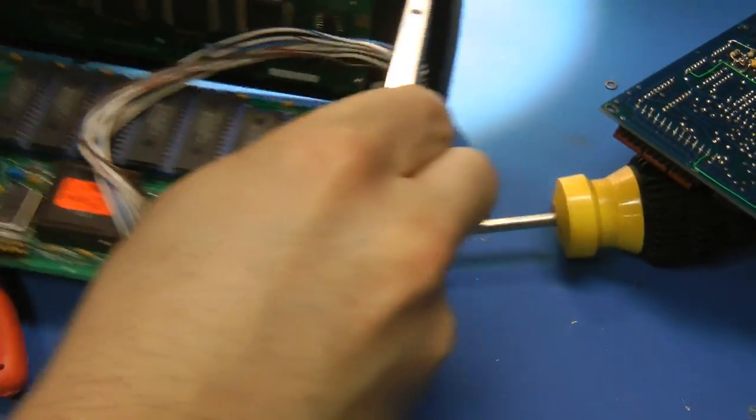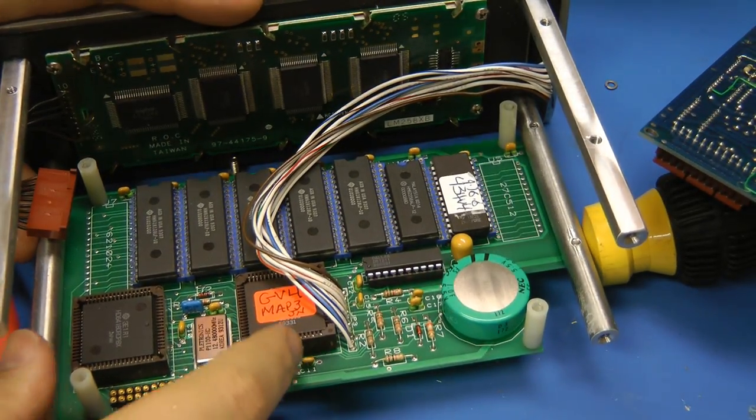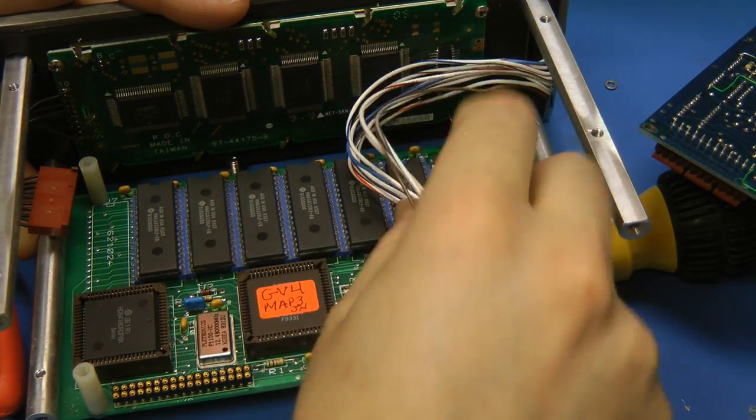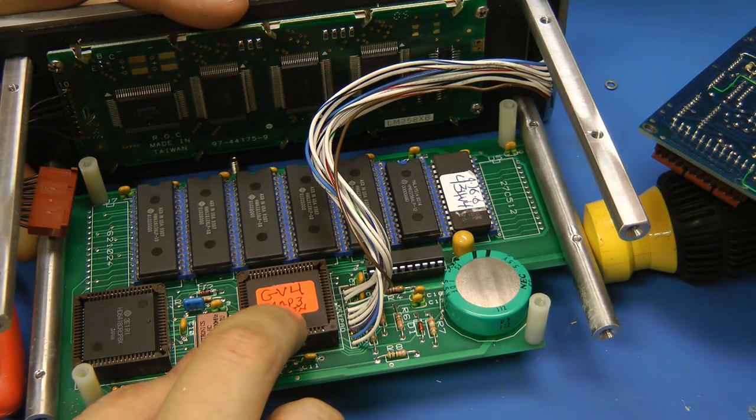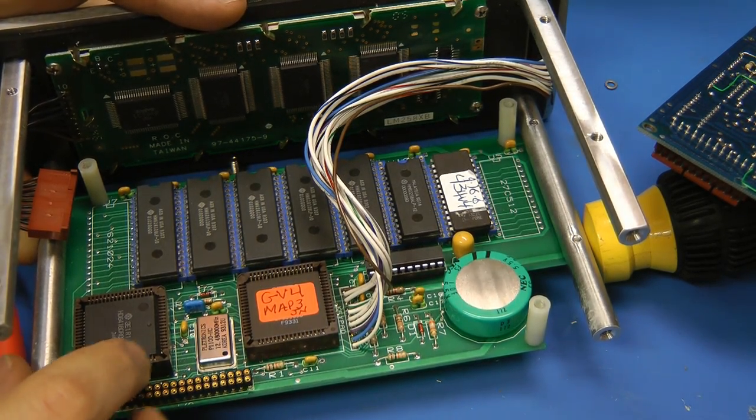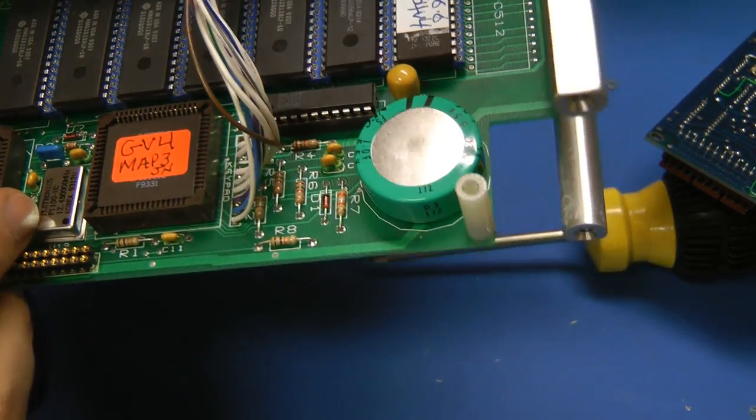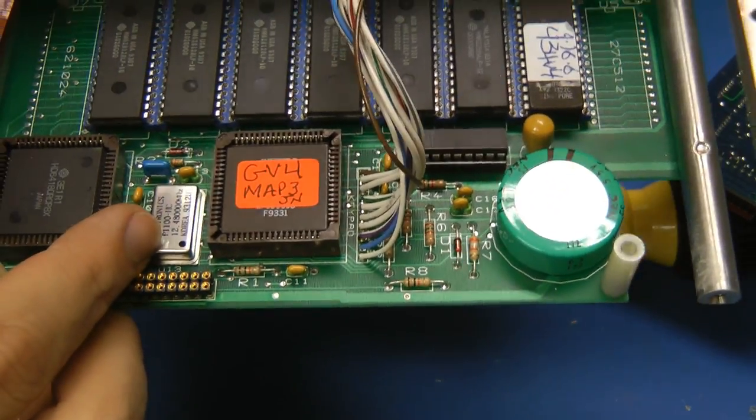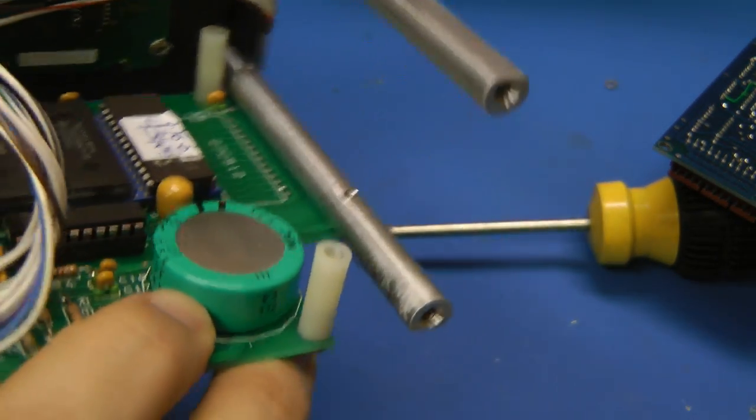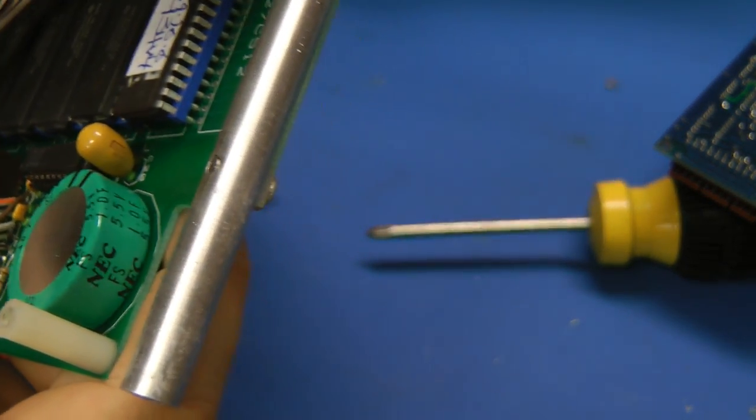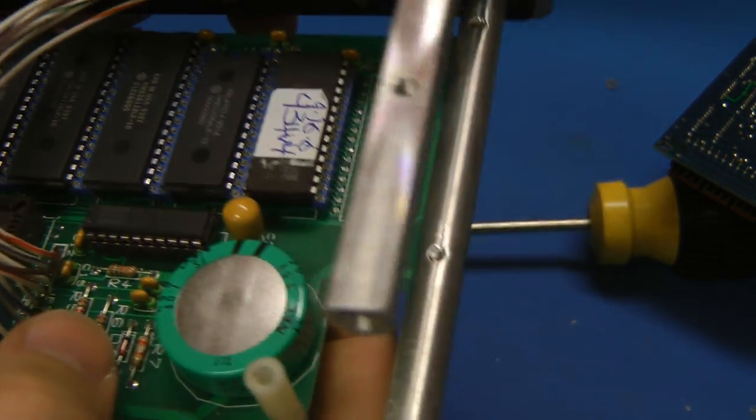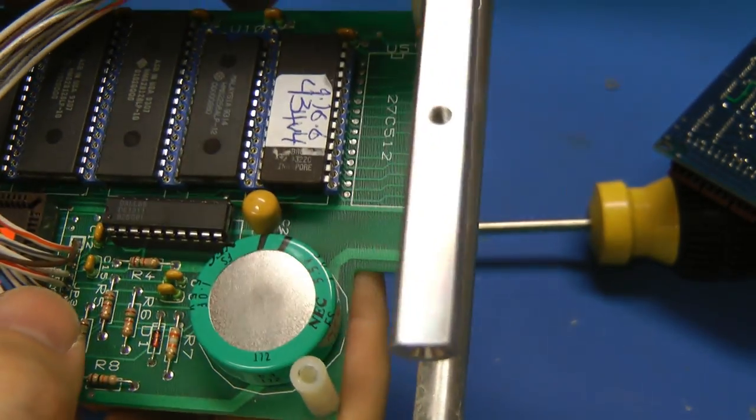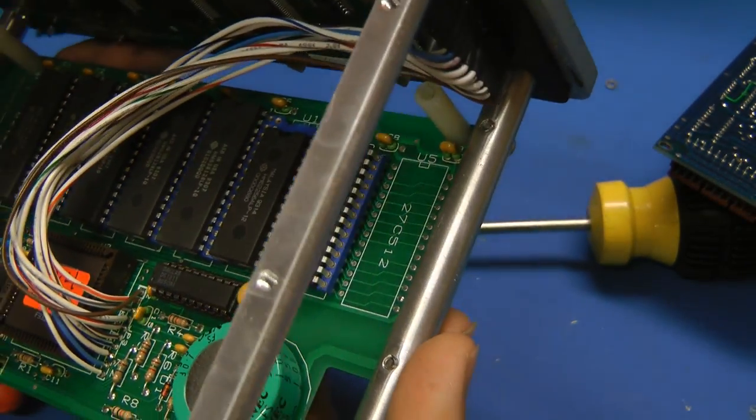And then on this side, yep. We just have, that must be the CPU program. GV4 map 3 something in. And then some random peripheral chips. Got a 12.48 megahertz oscillator. Supercap. 1 Farad. 5.5 volts for some backup. That's probably Dallas. That's probably the RTC chip right there. Don't see the crystal anywhere. Where would the crystal be? Unless that's just battery backed RAM.